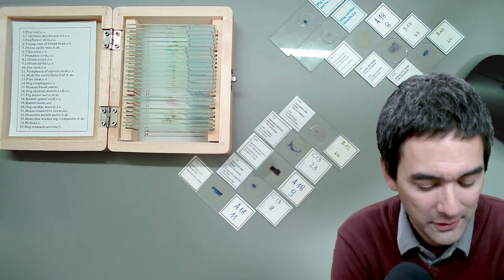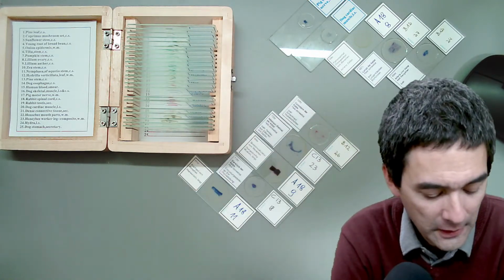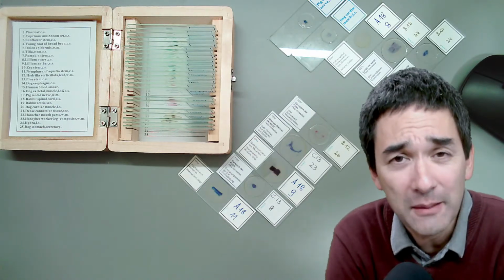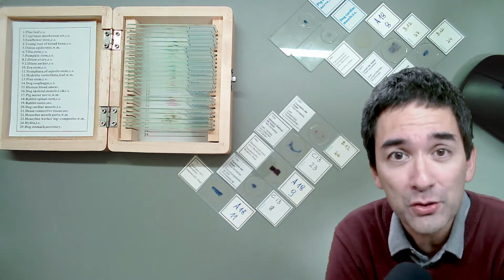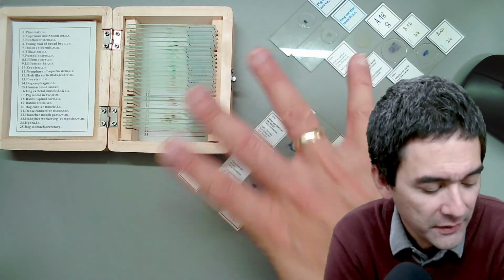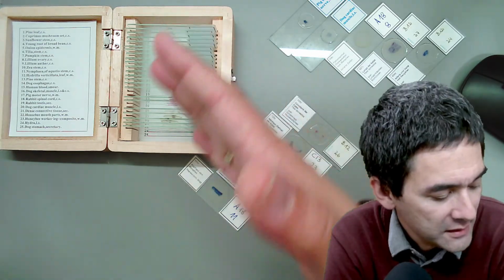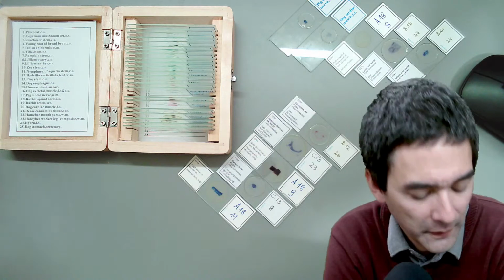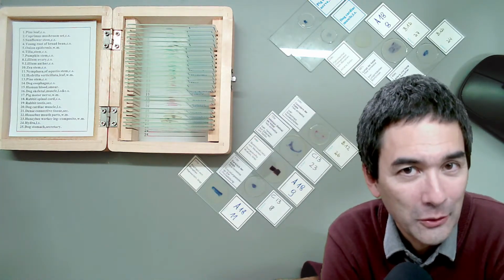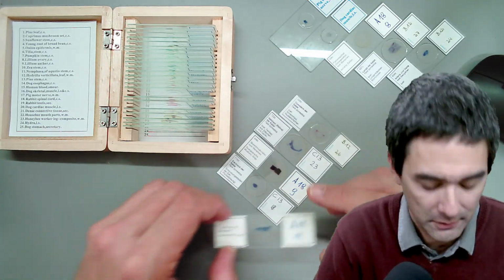I simply wanted to show them a little stuff under the microscope, and I showed them some of those slides. And she said something quite interesting: those slides all look the same. They all look so two-dimensional, so abstract. And indeed, that's the case. That's a disadvantage of those histological slides, that in many cases there is no description with them. So you're looking at things and sometimes you don't even know what you're looking at, which is a bit of a pity.